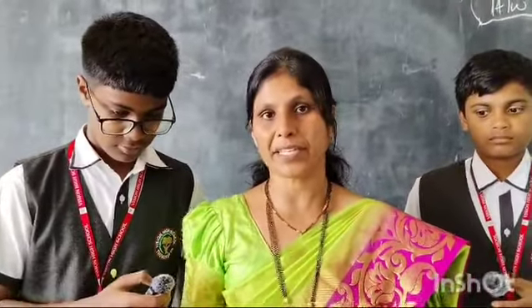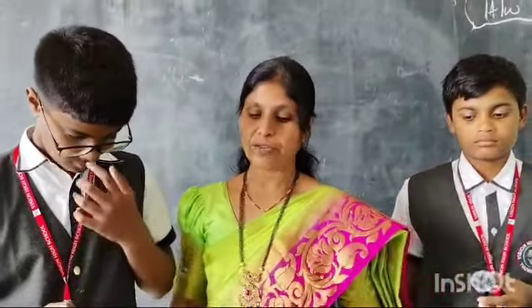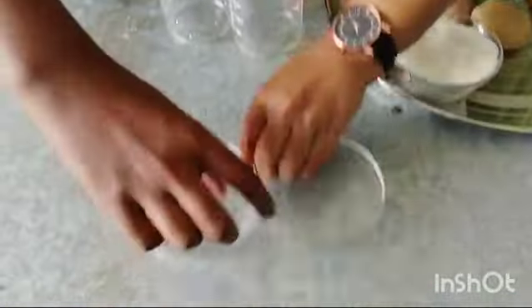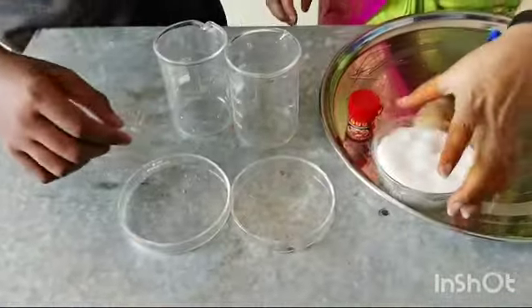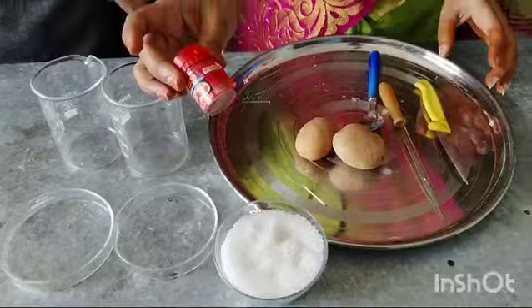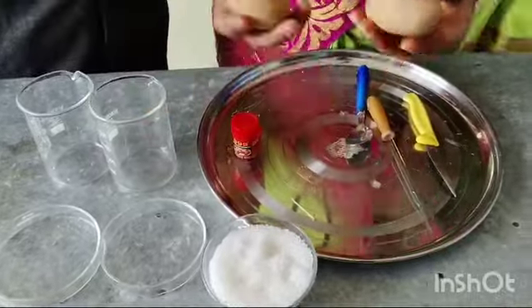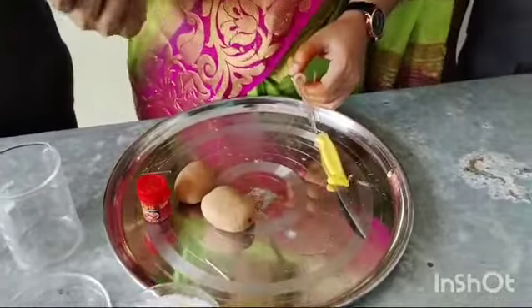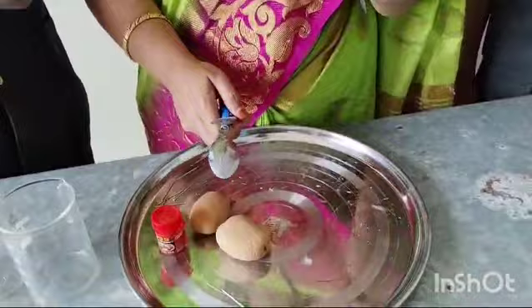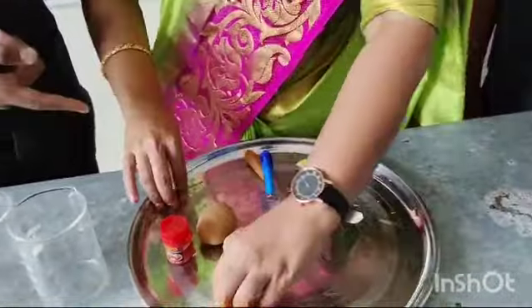How to prove it? To prove this we need to do an activity. For this activity the requirements are: two beakers, two petri dishes, sugar, food color, potato, dropper and one spoon, knife, and ball pins.